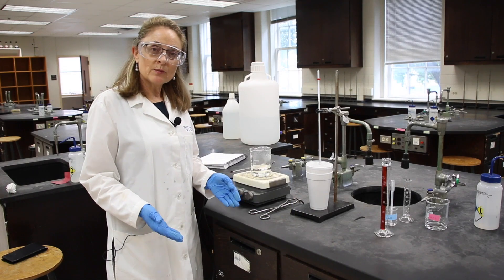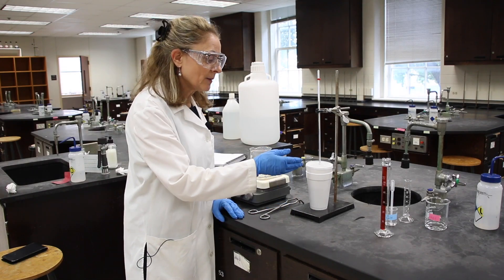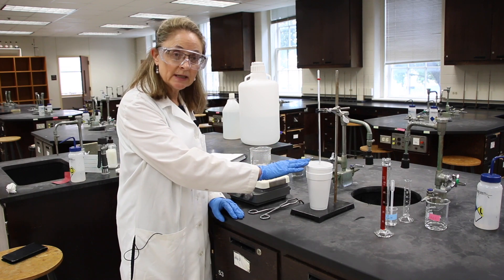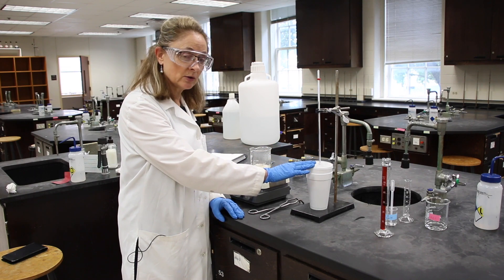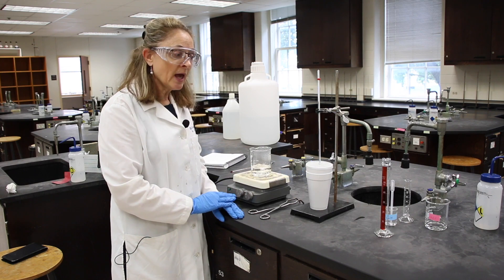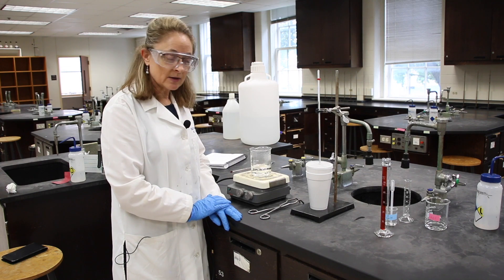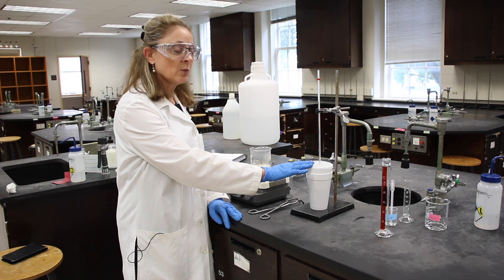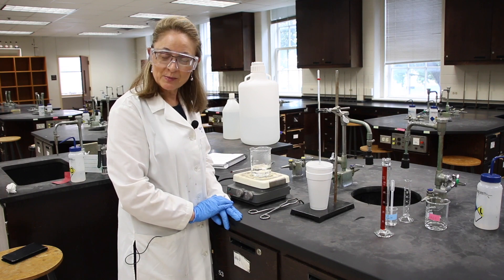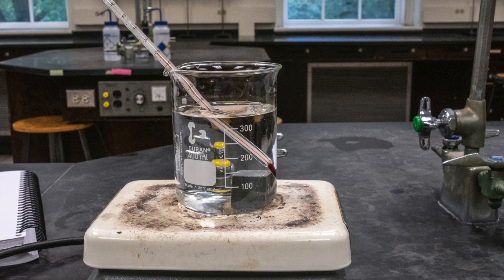Now we're done with the experiment — we can clean up. We'll dump all of our solutions to the drain, completely dry the metal cube and return it to its container, place all of our equipment in the center ready for the next group, and dry out our calorimeter cup. Thanks for being my lab partner today. Ciao.